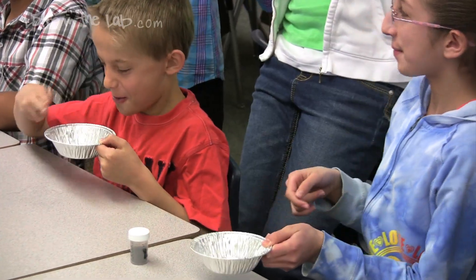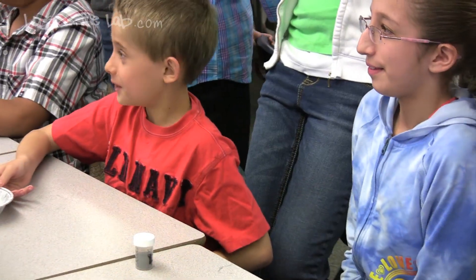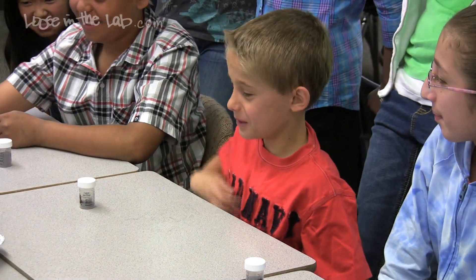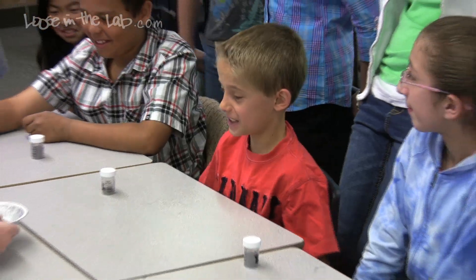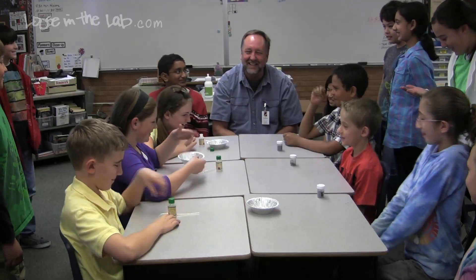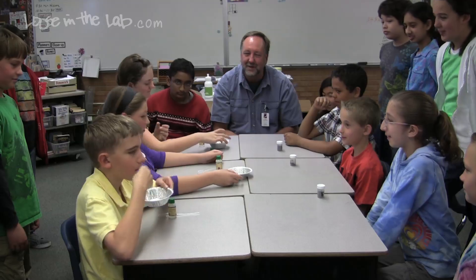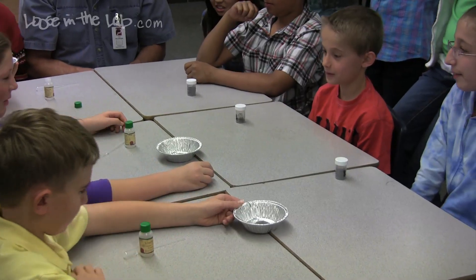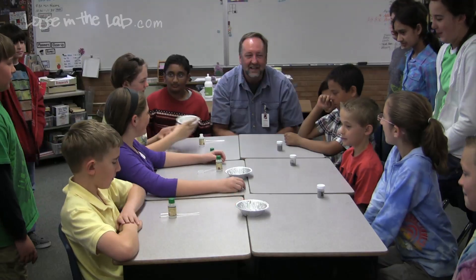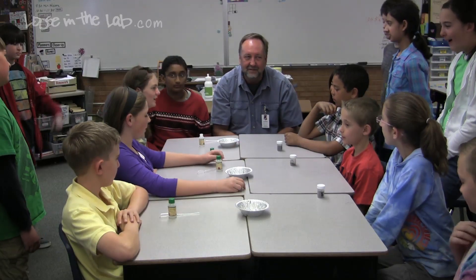It's a new odor. What's it smell like, Jacob? It smells like rotten eggs mixed with gas. Rotten eggs mixed with gas. Is this a physical change or a chemical change? Chemical. Chemical, because we produced a brand new odor.